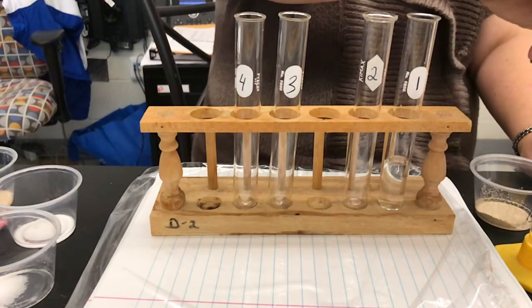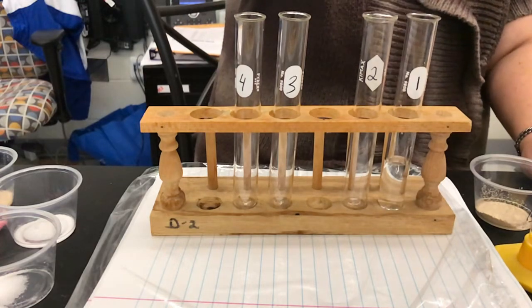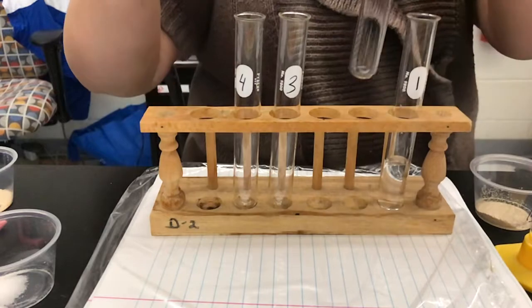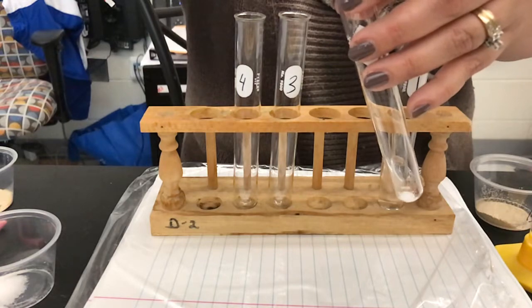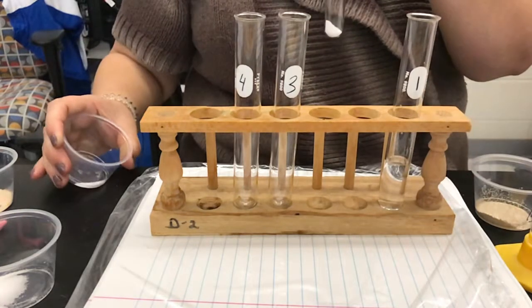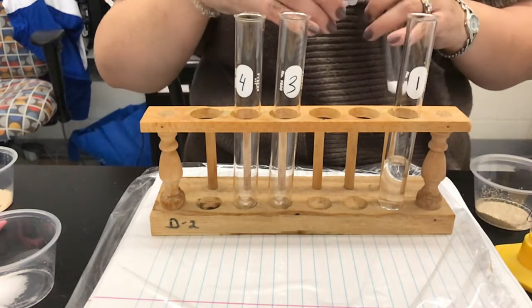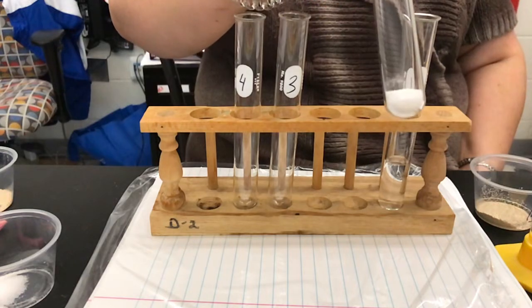All right, Dennis, what were you going to say about our next one? So this one, we're not only adding the water, but we're also adding sugar. I have pre-measured here two grams of sugar, and we're going to put it into our second test tube. There's our two grams of sugar — it looks like just regular sugar.